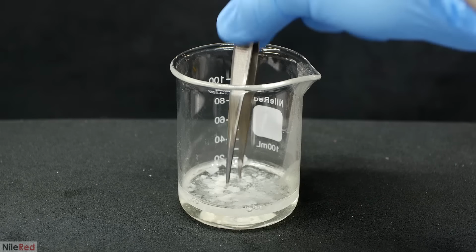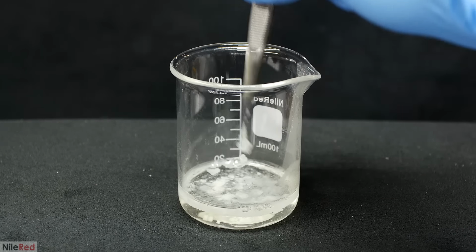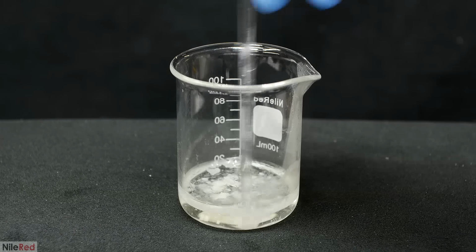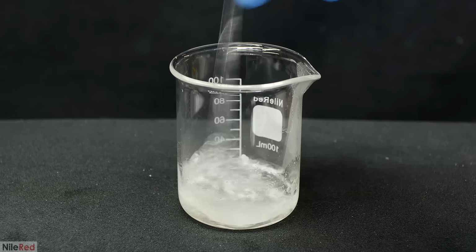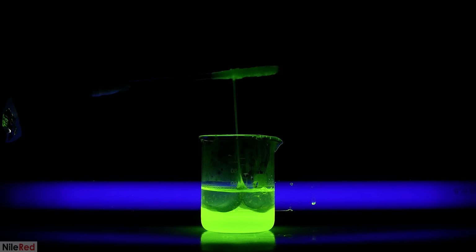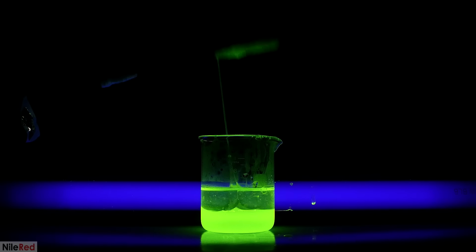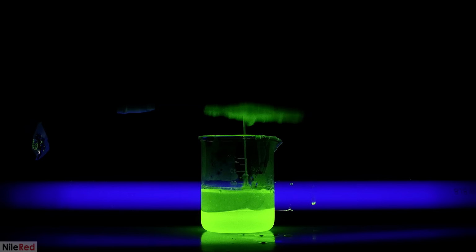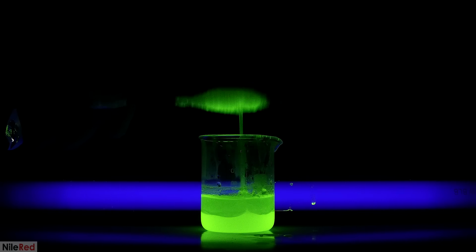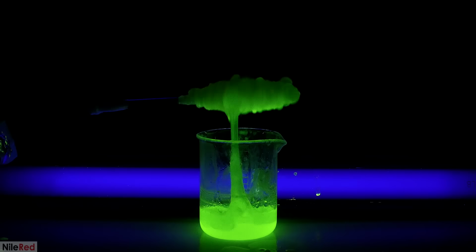In the other runs, when I pull it out using tweezers, it's an extremely thin layer and it makes it look like I'm pulling out a whole bunch of nylon. However, in reality, there's actually only a very small amount. For the last run, I used a lot more of each, and I thought it would take a while, so I used the drill as well. Near the end, it got super messy and was pretty gross looking.